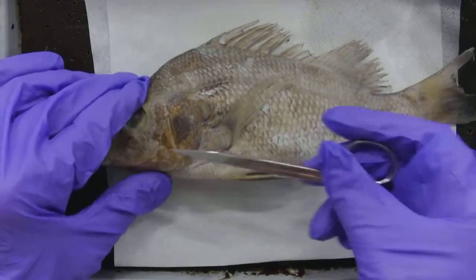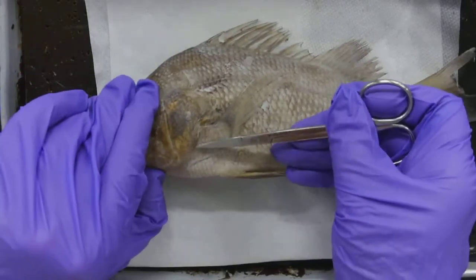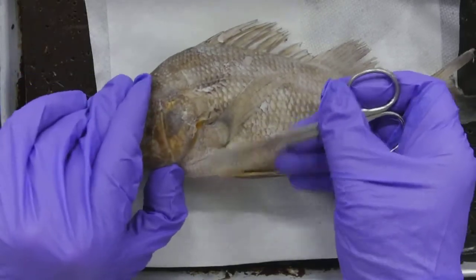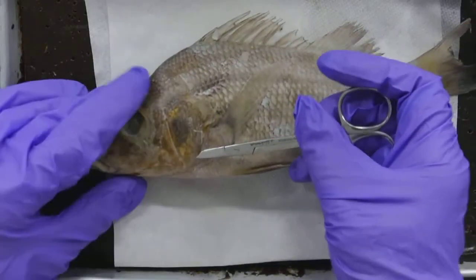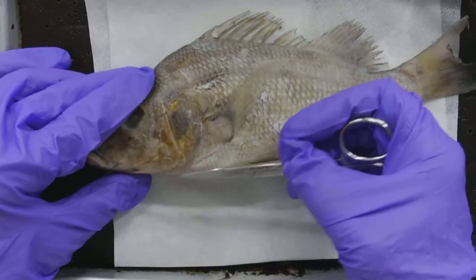I didn't point that out in external anatomy. Here is the operculum — there it is. See how that lifts up? We know that that's a bony feature, and we also know having looked at the model that the heart is located in here.